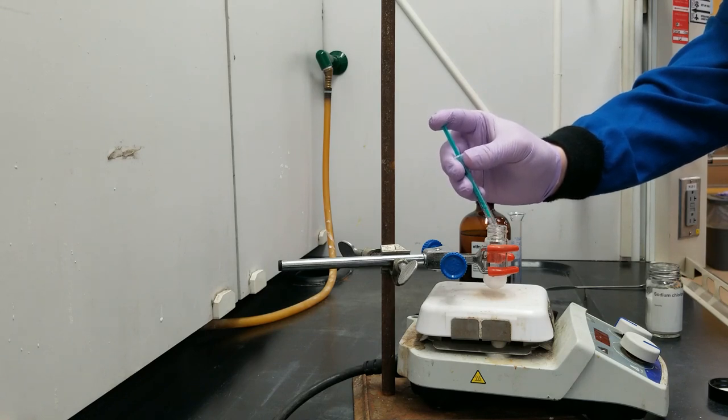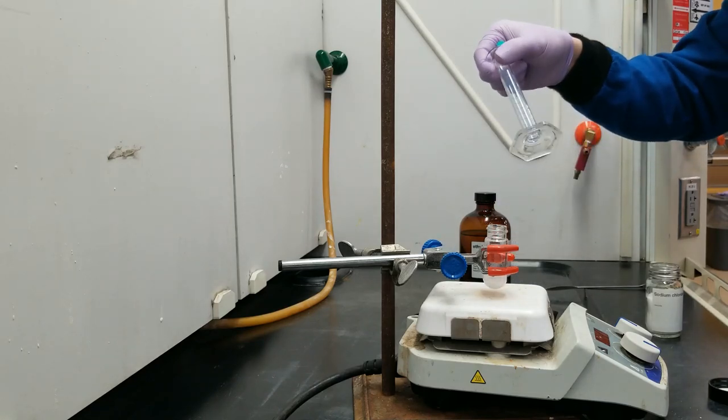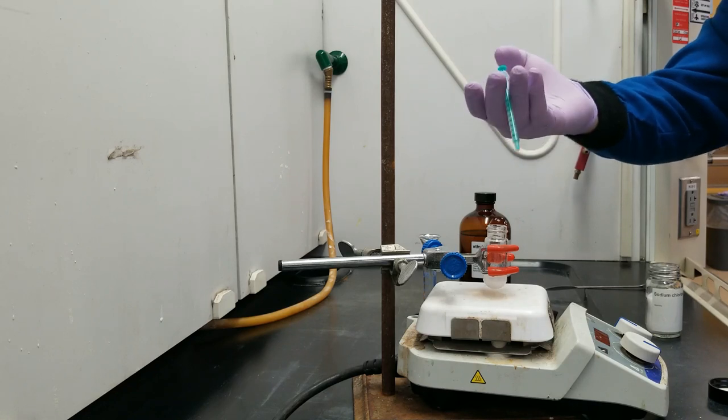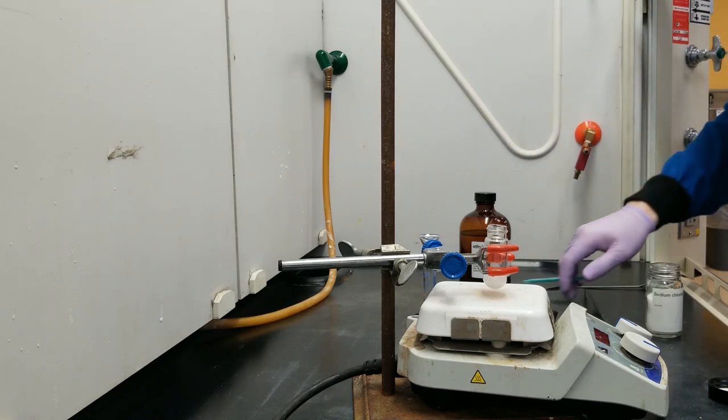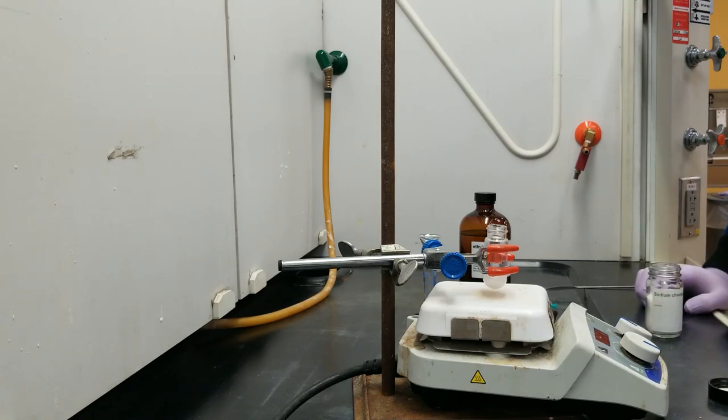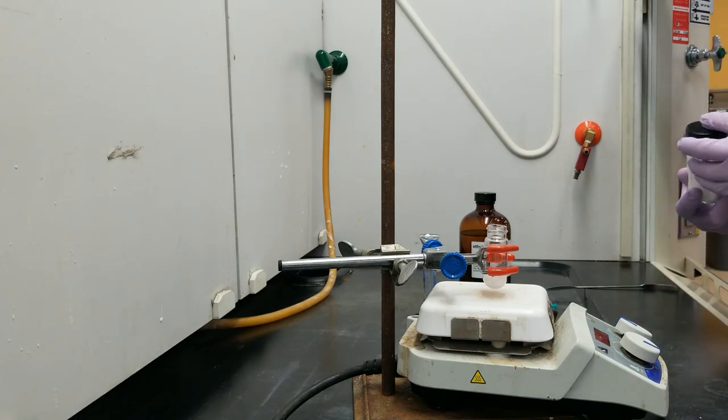And when dealing with really small volumes, like a half a milliliter, you can never get that with a 10-milliliter graduated cylinder like this. So I reach for just a one-milliliter syringe without the needle. With that being done, I'm going to get the stirring up as high as I can because I love a good yield. And this exciting reaction is going to go for 15 minutes. And I've got a couple of things that I want to point out about it.